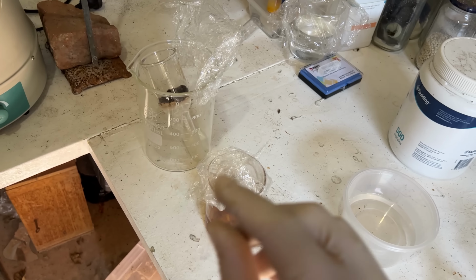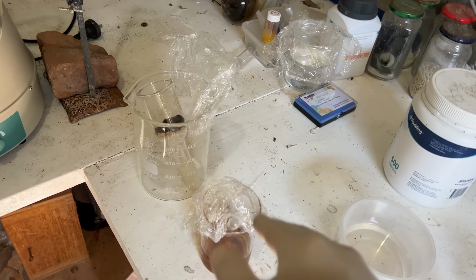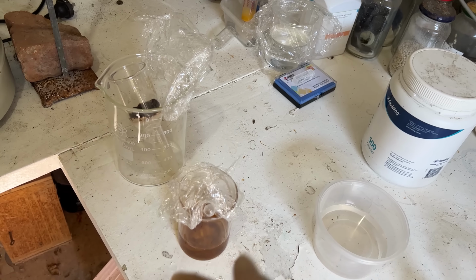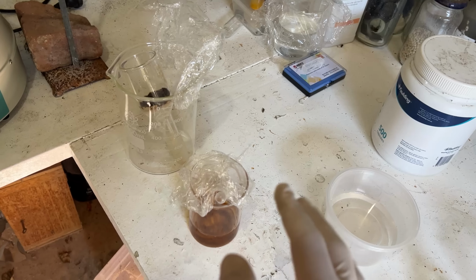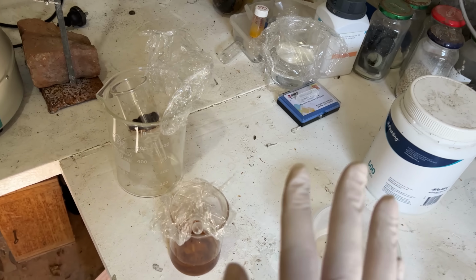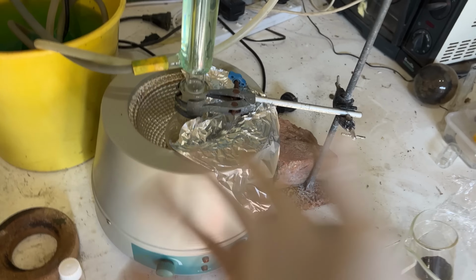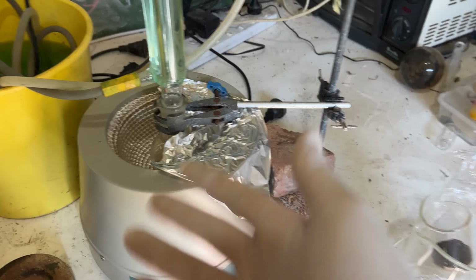Just because of the scale we were working on, it's hard to reflux a reaction where it calls for like 5 mils of water or something. I can't remember. I ended up using 30 mils or something. So it's just such an excess of water because of the small scale we're working on. And my stuff is just not set up to do very small reactions. You know, I'm like, oh, I'll get a small flask, which is like a 250 mil flask for me.